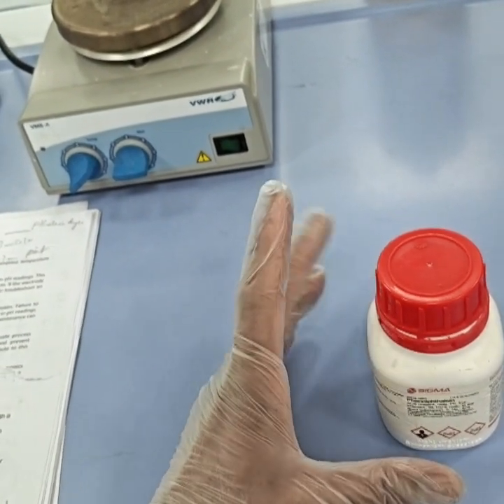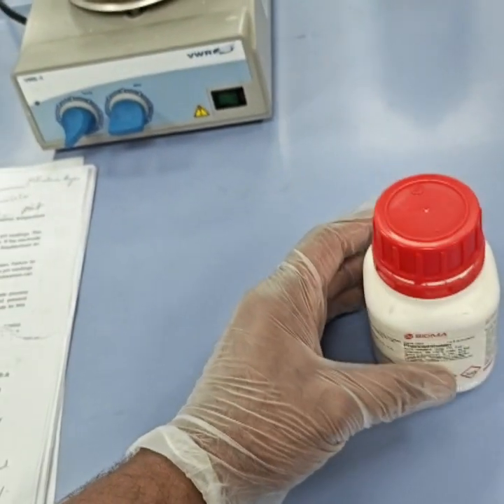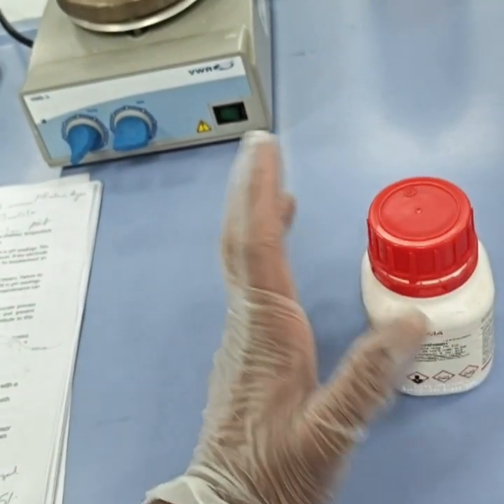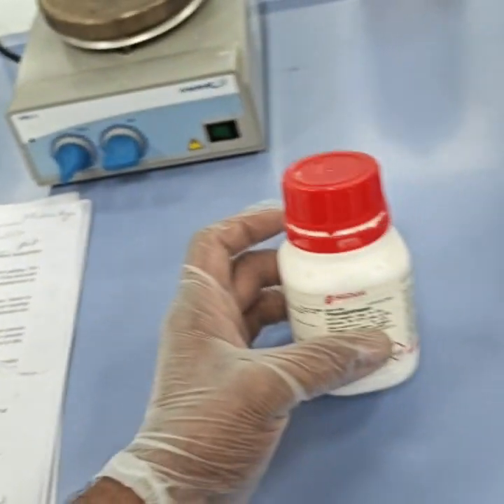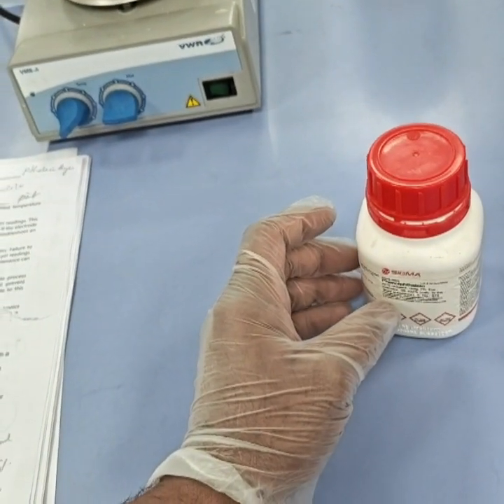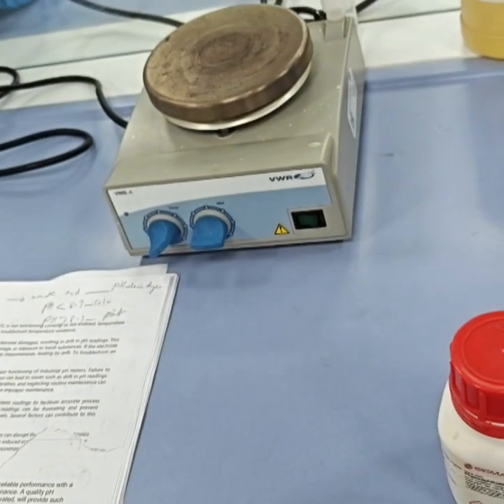of 95% ethanol or methanol, because this is sparingly soluble in water. It means there will be 95 ml of the ethanol or methanol and 5 ml of the water. And then the rest of the amount would be distilled water. So first of all, we dissolve 0.5 gram in 50 ml of the 95% ethanol, and then we add the rest of the distilled water.